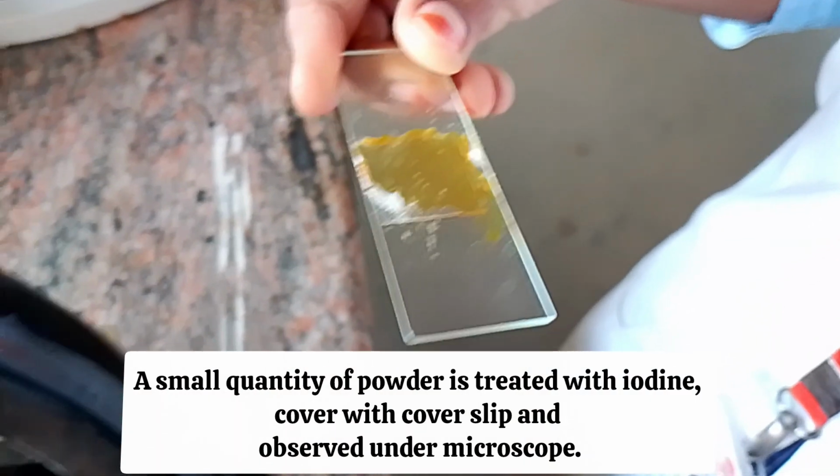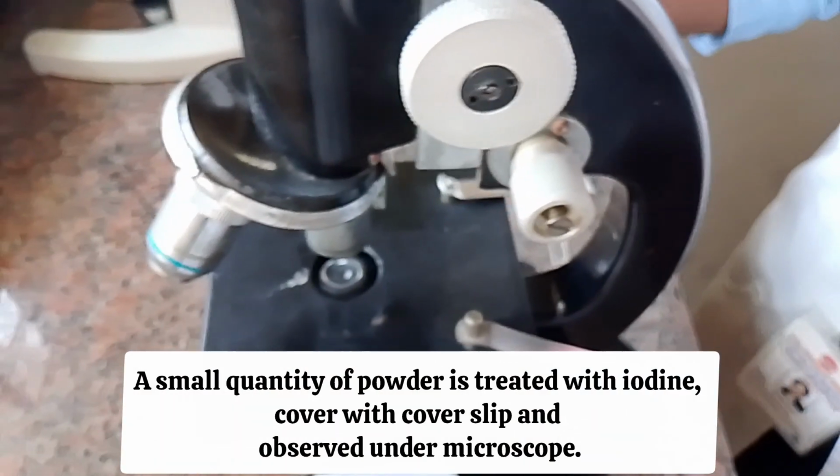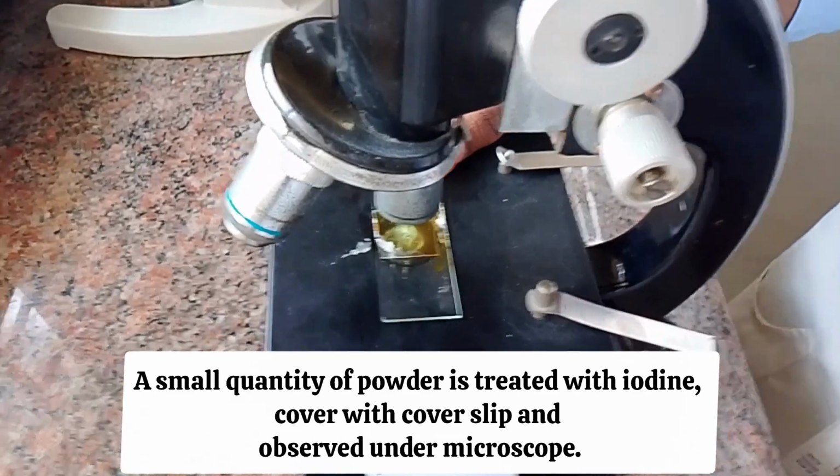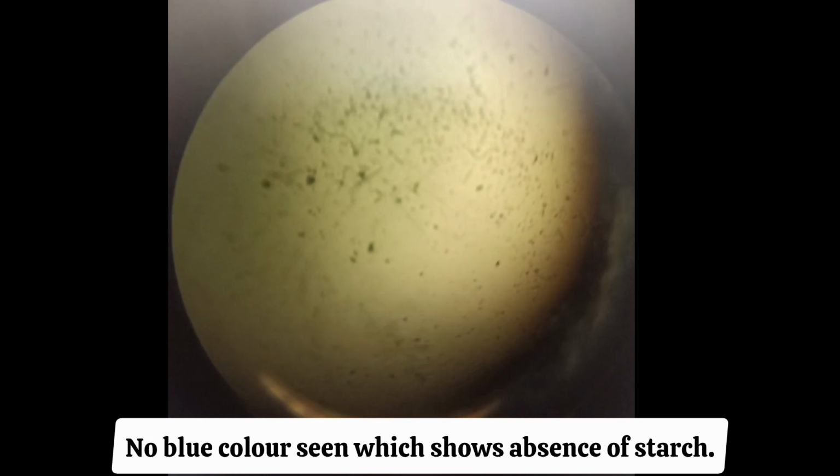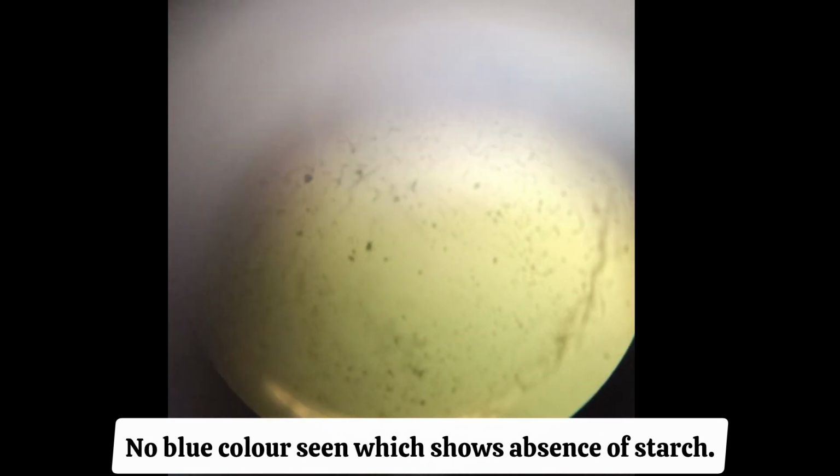A small quantity of powder is treated with iodine, cover with cover slip, and observed under microscope. No blue color seen, which shows absence of starch.